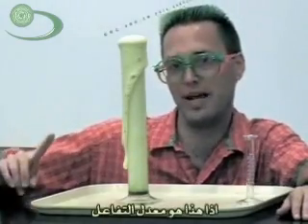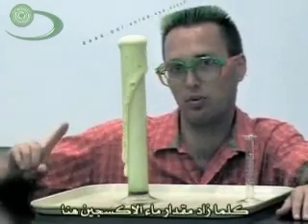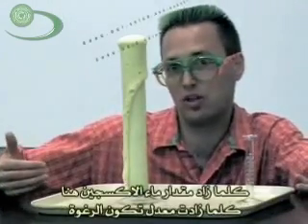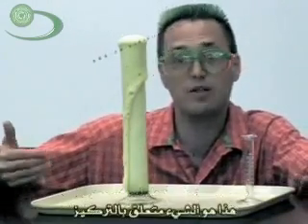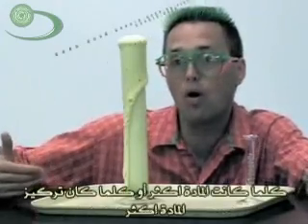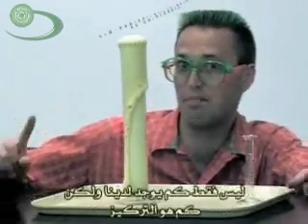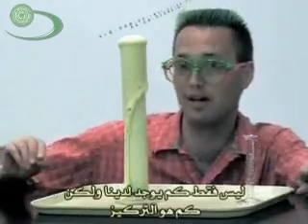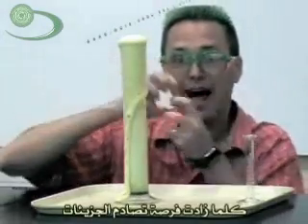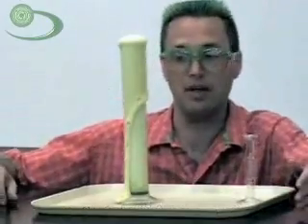So this is a reaction rate. The more hydrogen peroxide that's in there, the faster this should happen. That's one of the things about concentration — the more of a substance, the more concentrated a substance, not just how much it is but more concentrated, the more likelihood that two molecules will collide and then have a reaction happen.